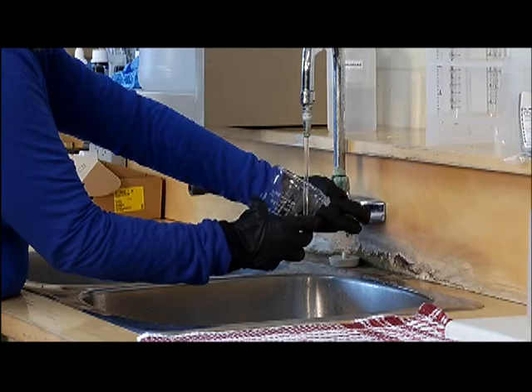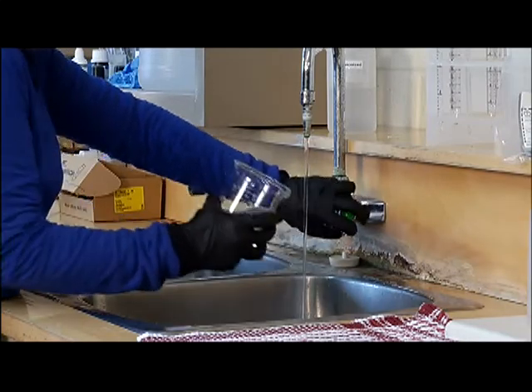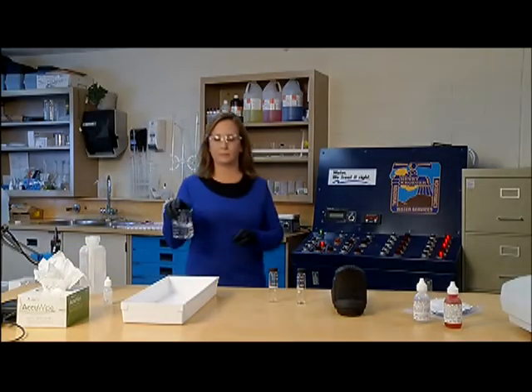Slow the flow of water from the tap, collect the sample and move to the testing area.